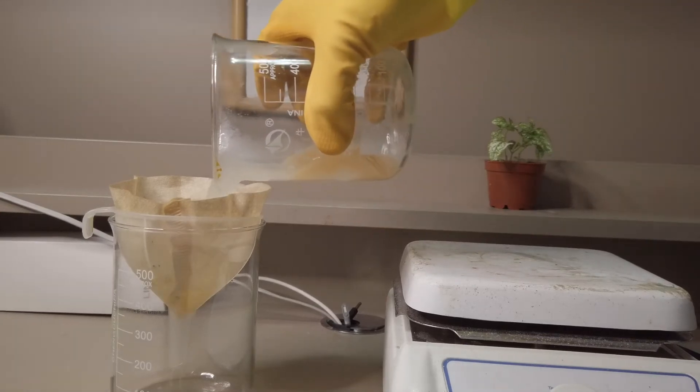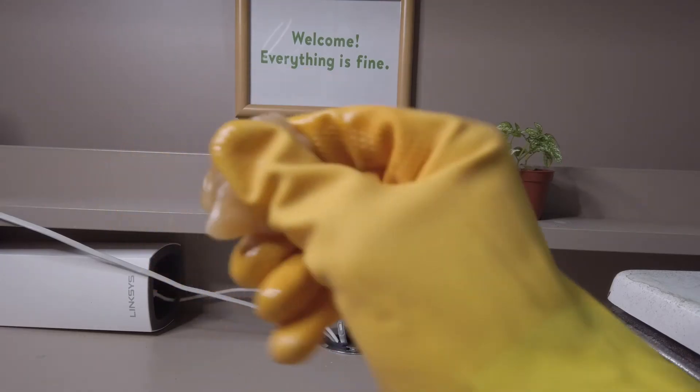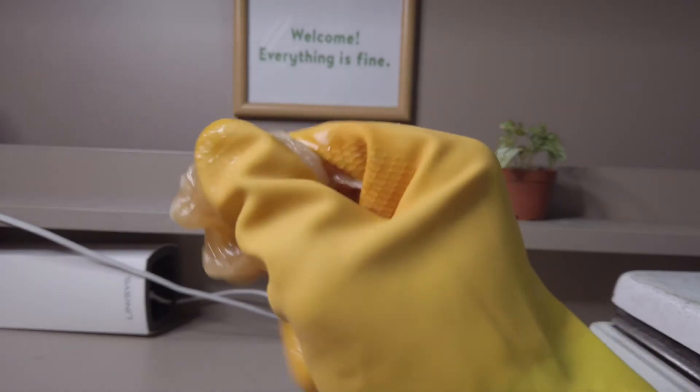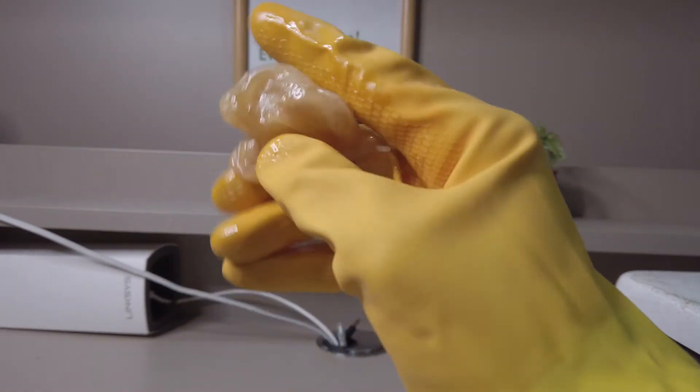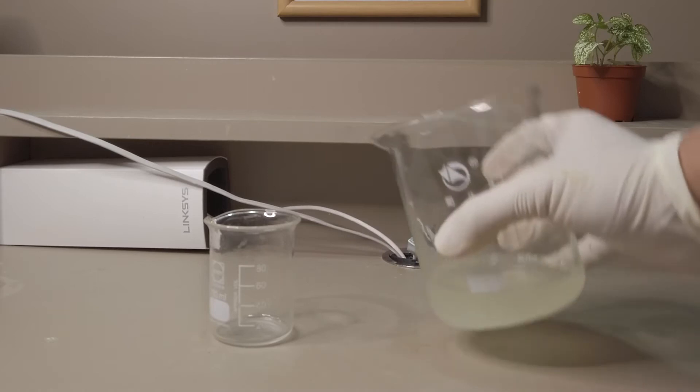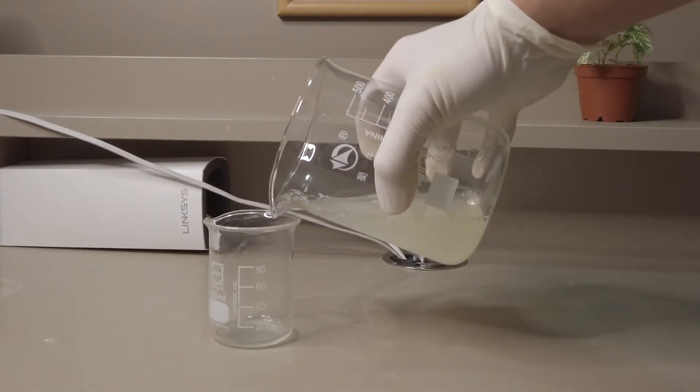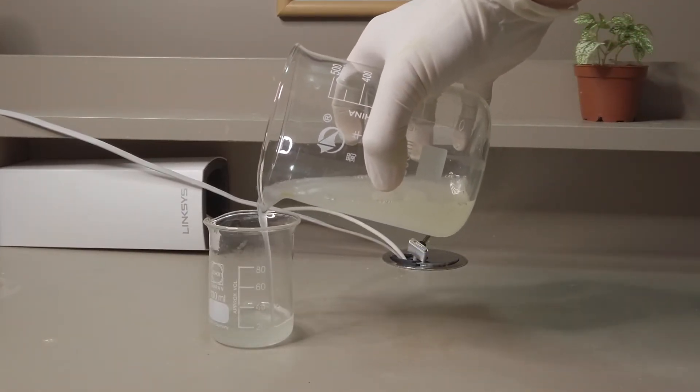We filtered off the solution and messed with the gooey polymer a bit. It's like a mixture of rubber band and play-doh but it was a lot more disgusting. A portion of the filtrate is transferred into a smaller beaker and put aside for the time being.